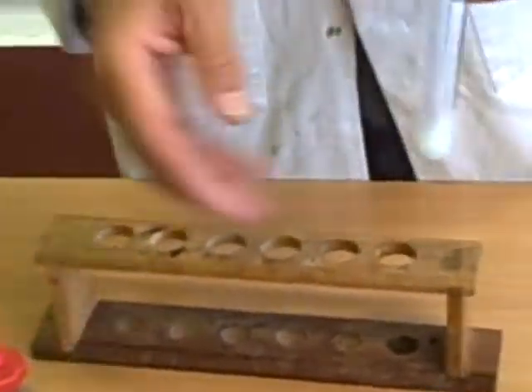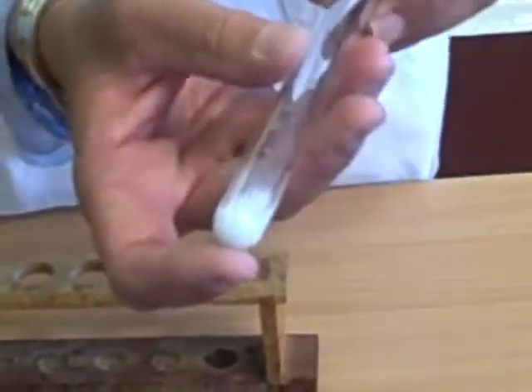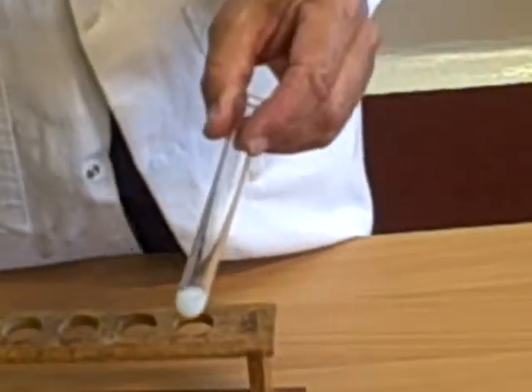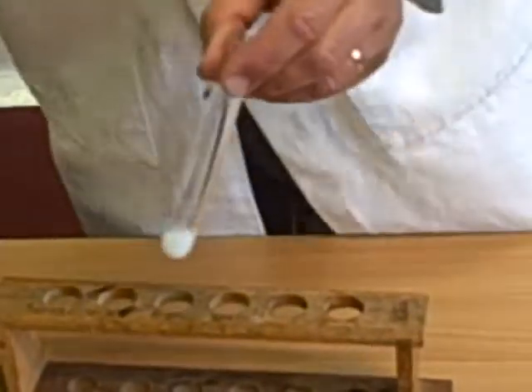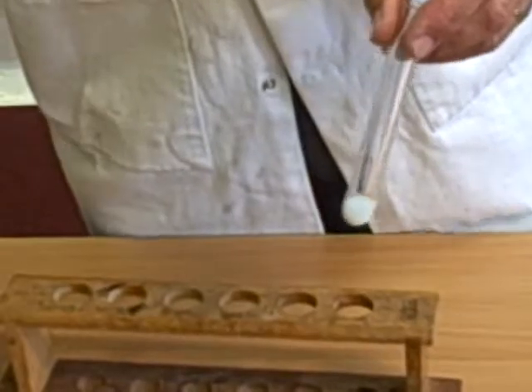If you swirl that around, you will see a fine powder. So copper chloride, and it's the chloride this time, will react with silver nitrate.